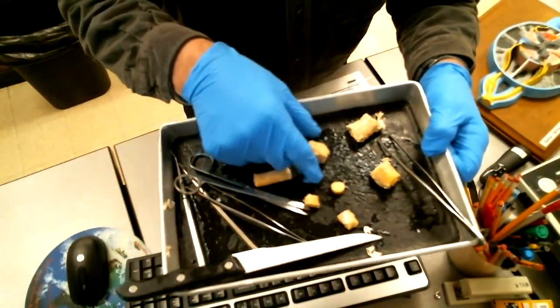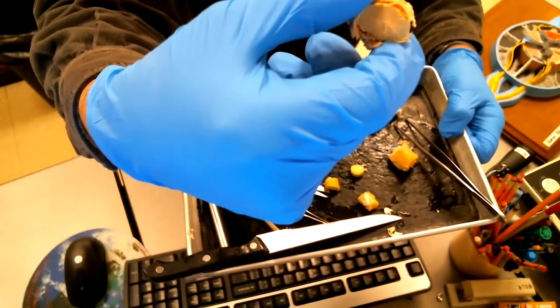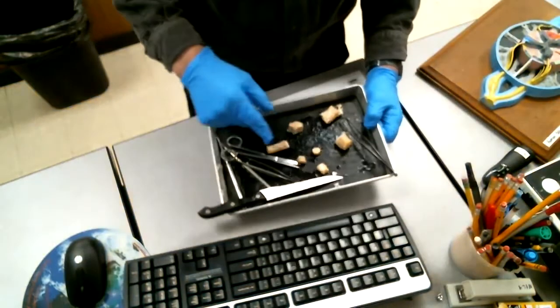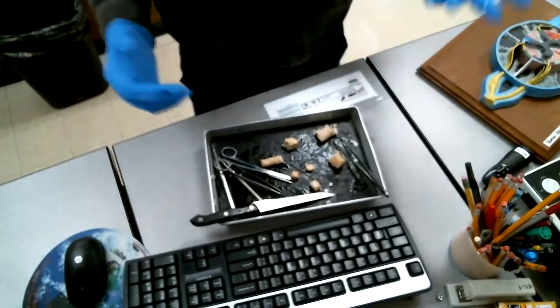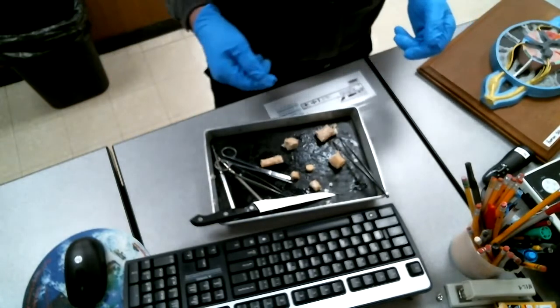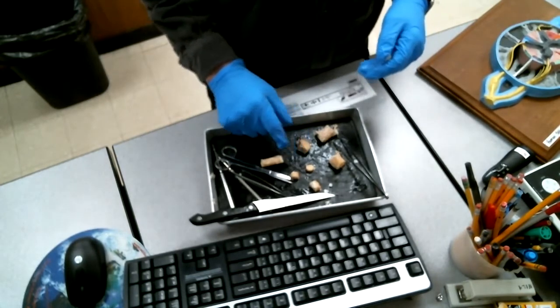If I tilt it up, maybe if I get it like that, there you can see gray matter, white matter. You can see the commissure. You can see the space around it, maybe even the central canal. You're going to have to get close with your phone to get a good picture of that. Okay, so very simple dissection. Again, these are in a preservative. The preservative can go right down the drain when you open your baggie. This should be able to stay in the bag if you want to keep that for studying.